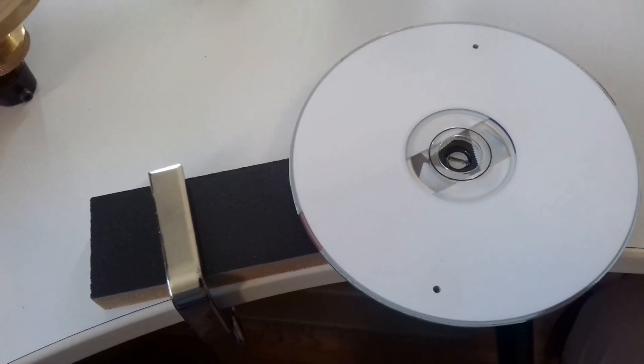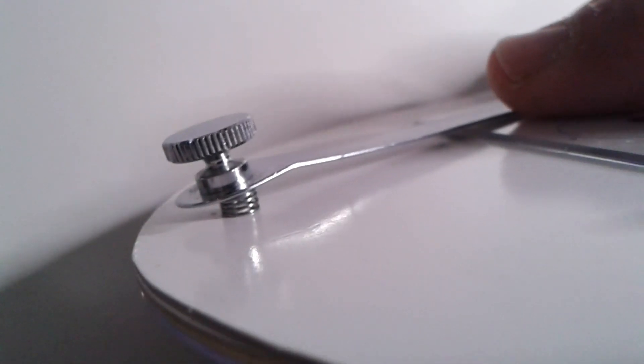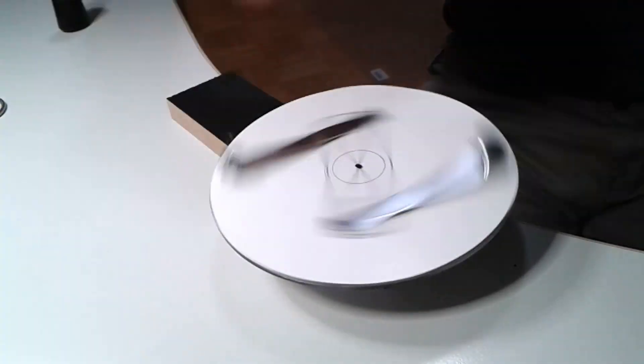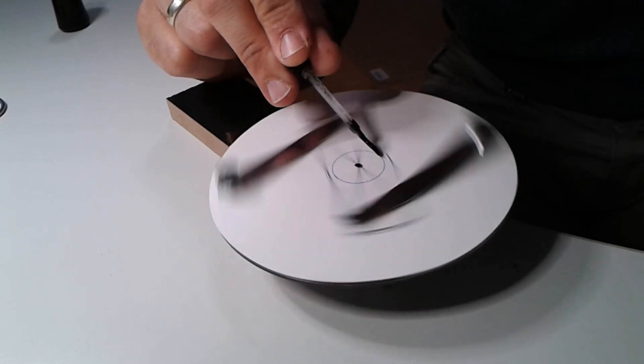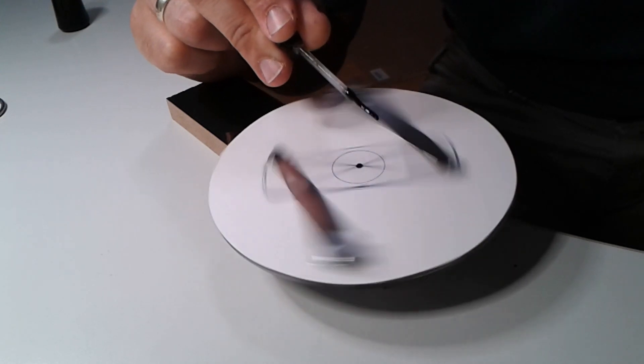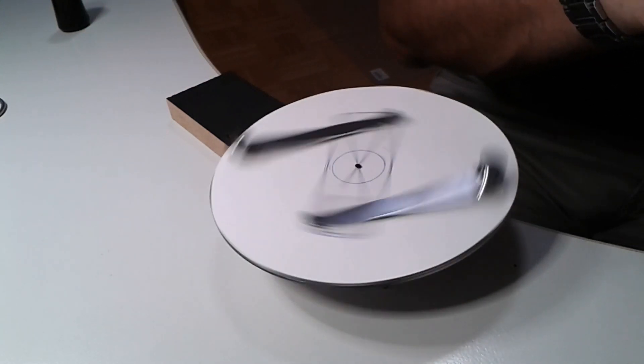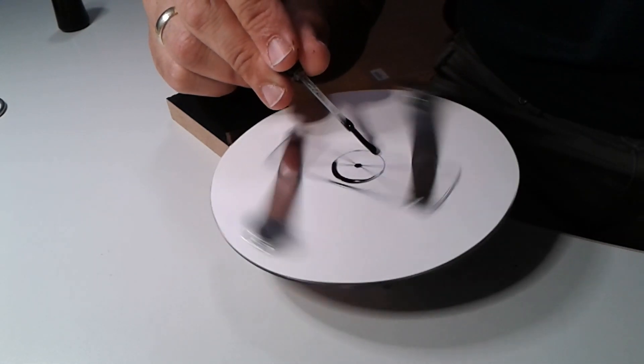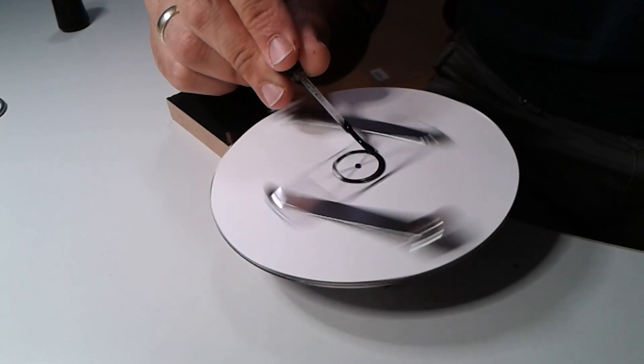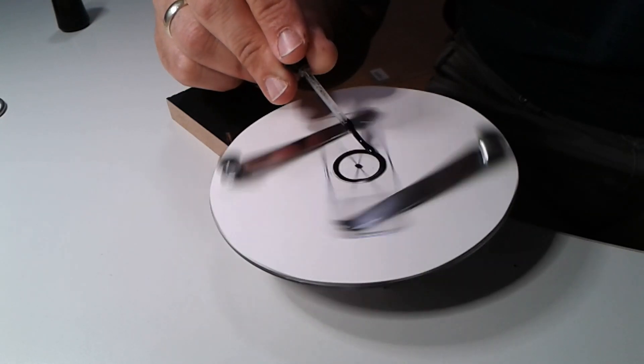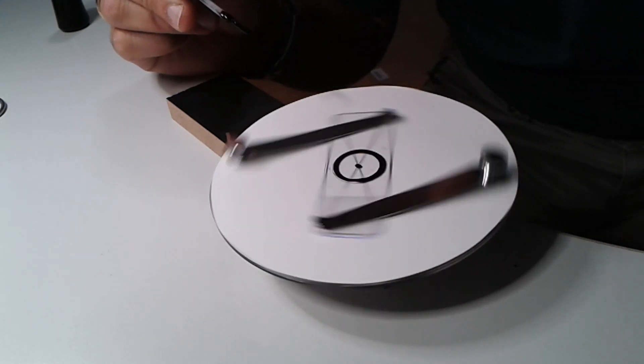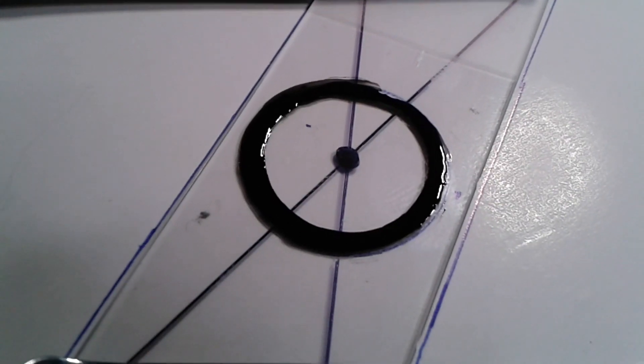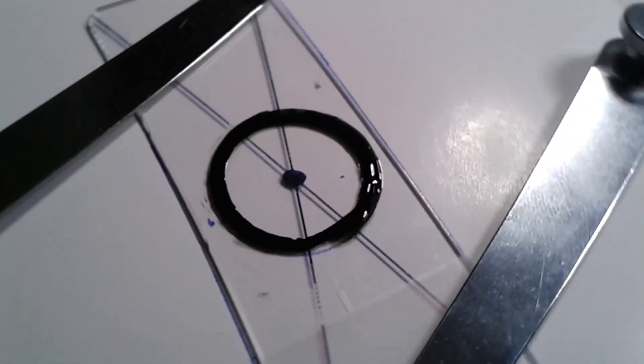I used clips from a stereo microscope and attached them using a spring from a ballpoint pen. When you don't thin down the nail polish sufficiently, nothing comes off the brush. It's necessary to experiment and add some acetone to make sure the nail polish is sufficiently fluid to make a nice ring. It might be necessary to add about 25 percent acetone. If you don't thin it down sufficiently, the ring is not perfect but it's good enough.